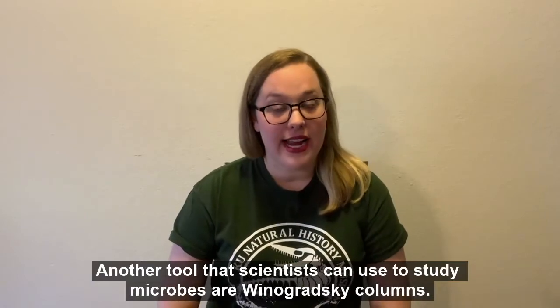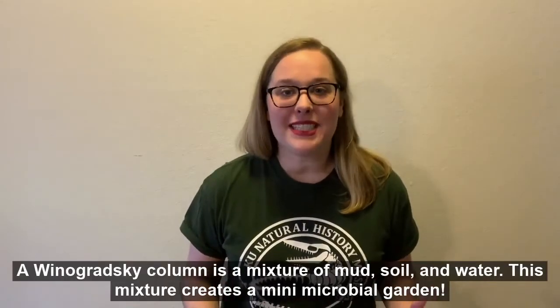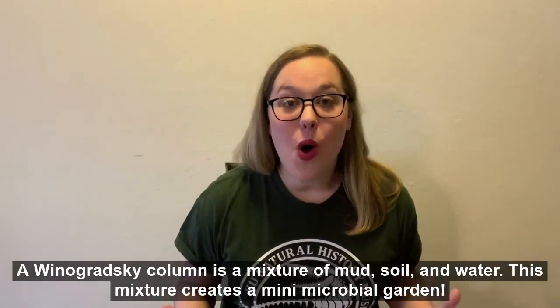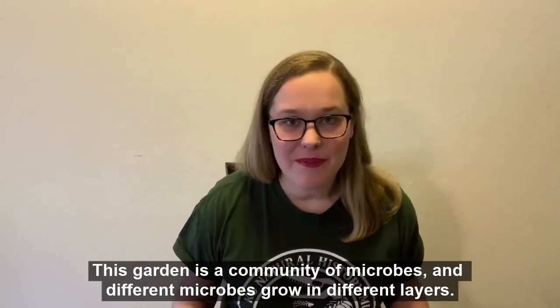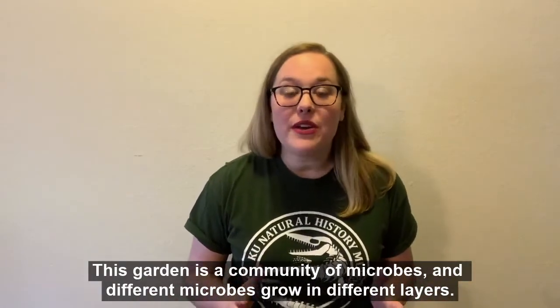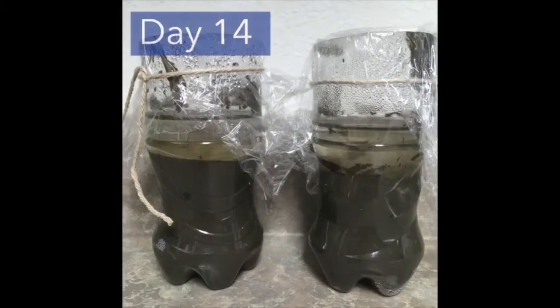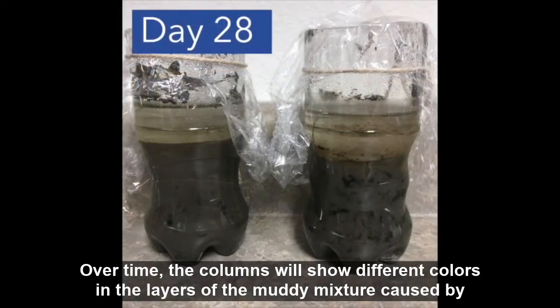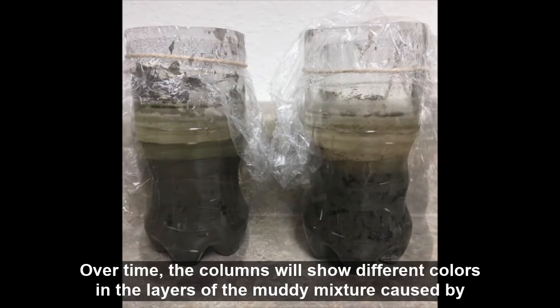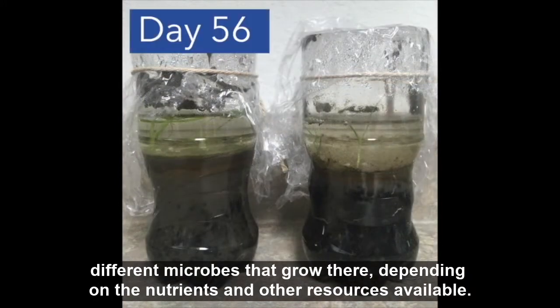Another tool that scientists can use to study microbes are Winogradsky columns. A Winogradsky column is a mixture of mud, soil, and water. This mixture creates a mini microbial garden — a community of microbes where different microbes grow in different layers. Over time, the columns will show different colors in the layers of the muddy mixture, caused by different microbes that grow there depending on the nutrients and other resources available.